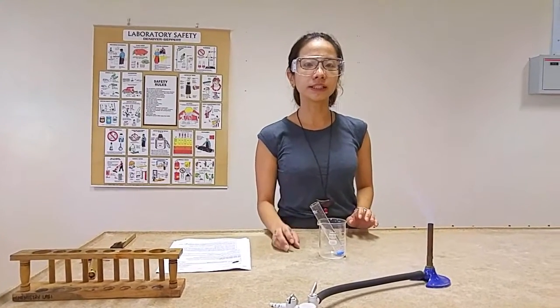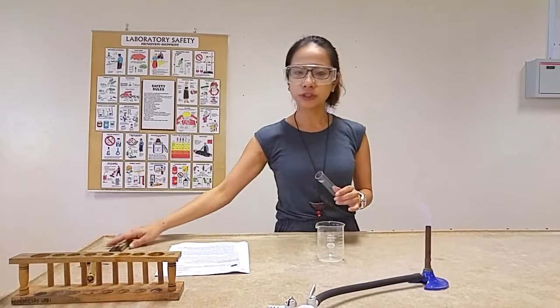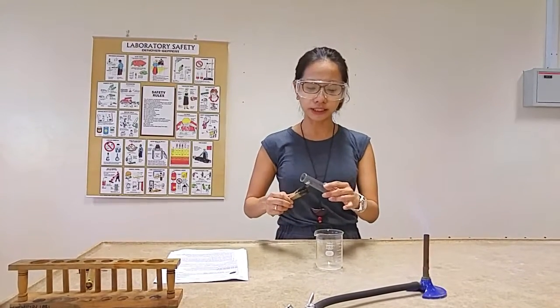We're going to do a gravimetric analysis experiment involving dehydration of copper sulfate. I'll be showing you the techniques to go about heating your solid.